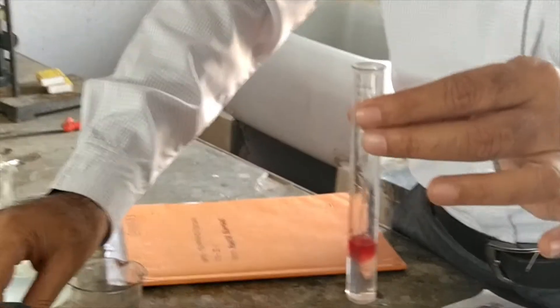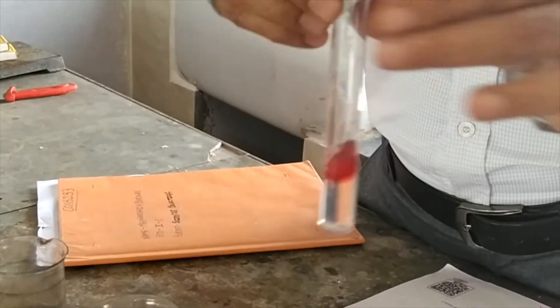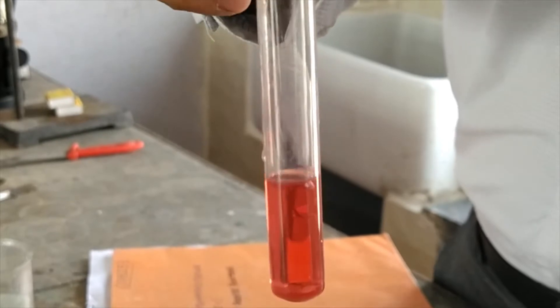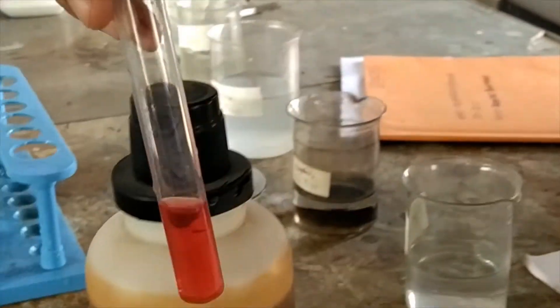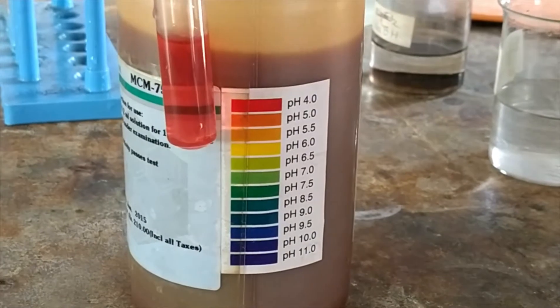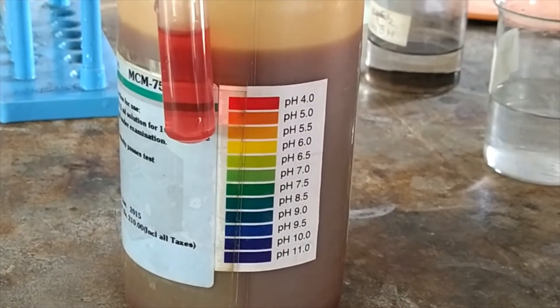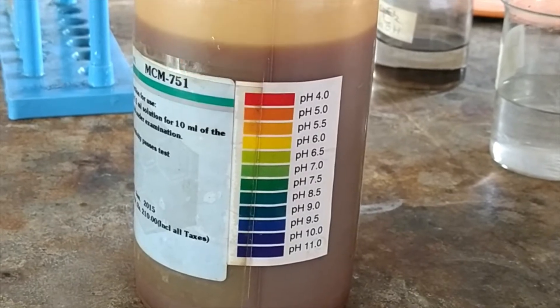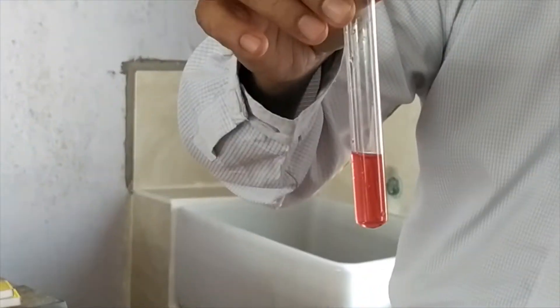Can you see the color change? Now I will check it properly. See the color change — what is the color? It is red. Now let us check the pH. The pH of the solution is 4, and this is red in color. So this is dilute hydrochloric acid.